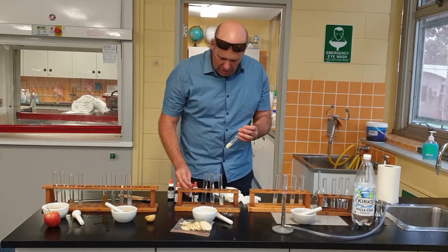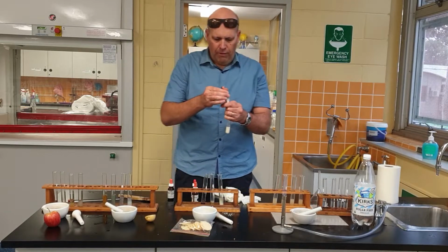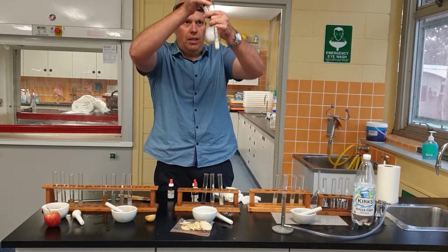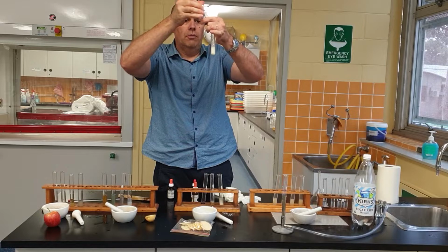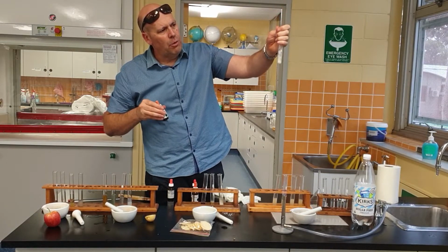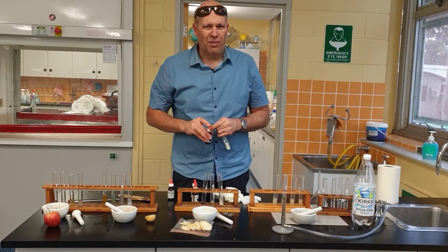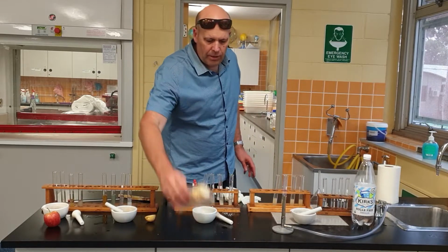This one's actually the silver nitrate. Well, it's not silver nitrate. The silver nitrate is the test for salts. So let's just do a, see my hand there. I'll put a little bit, oh, look at that. It's gone very dark now. It did change. It went a bit black. Well, we got a change, absolutely. And if you think about rice crackers, they have lots and lots of preservatives, and salt would be one of them. Okay, so there you go.